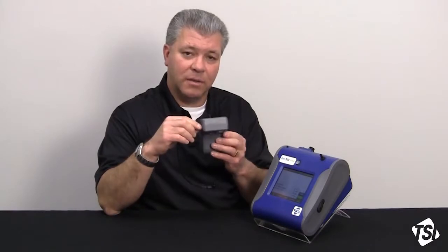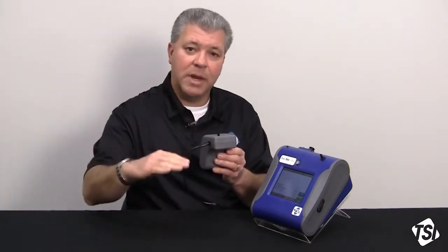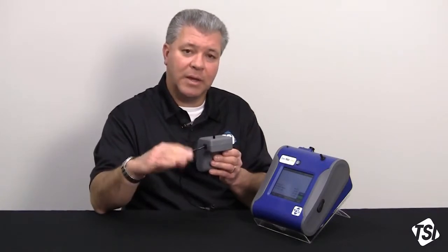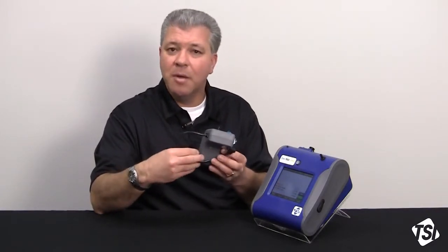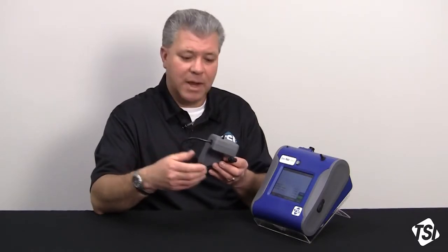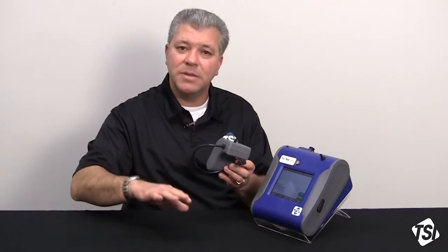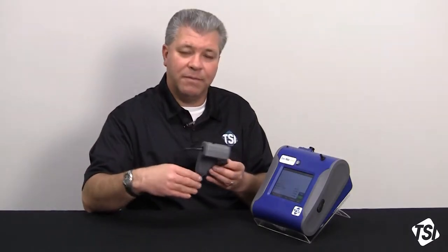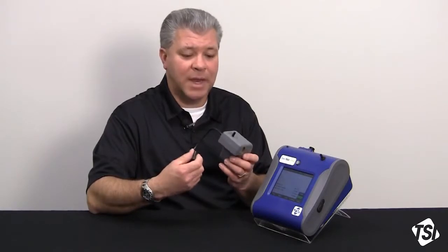Even during a 2-minute log interval, half of that time will be zero concentration, but half of it wouldn't be. So that data point really is going to be reduced, but it's not going to have the effects shown at all in the overall logged average data.